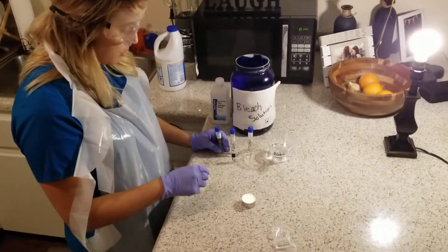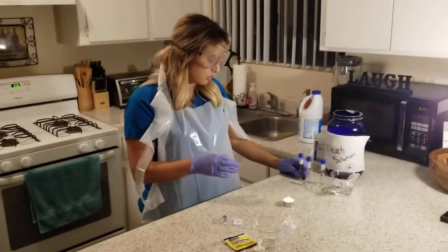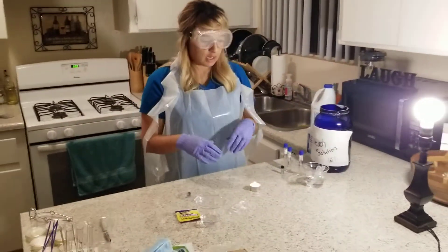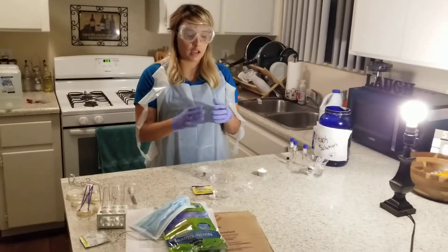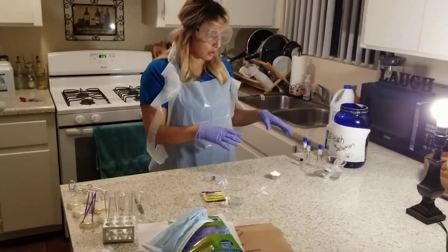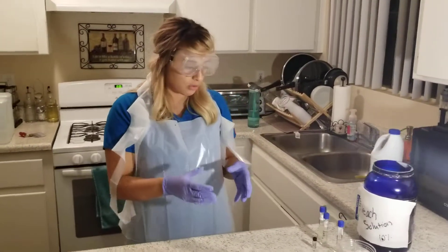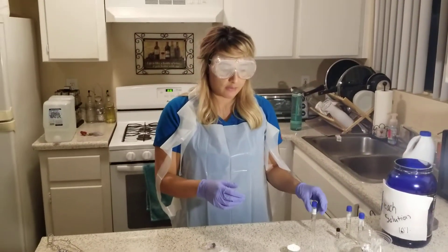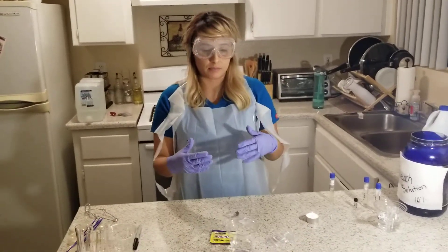I will be performing this for all three cultures. I then have to place them in the incubation areas that I have chosen so that the microbe could grow in my broth. After 48 hours the culture should have some growth.